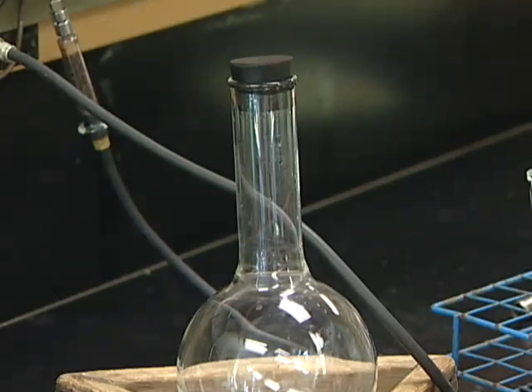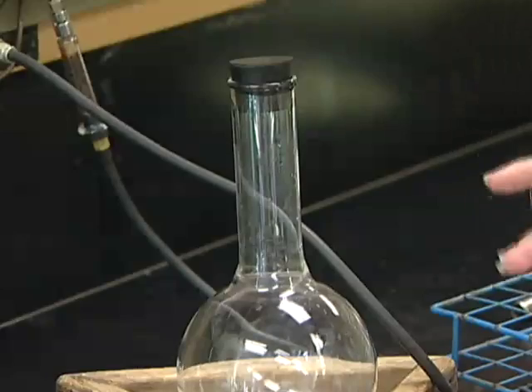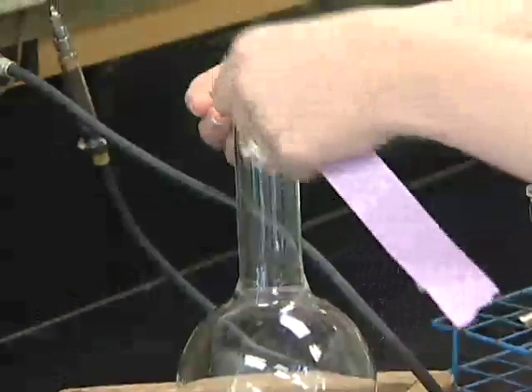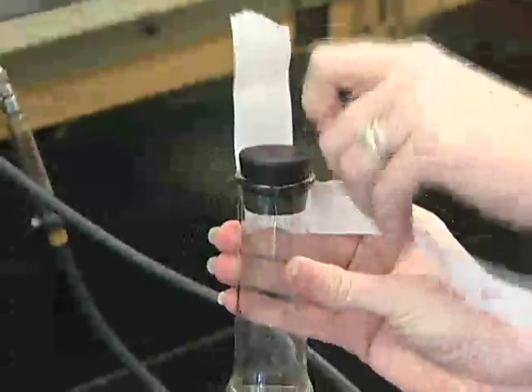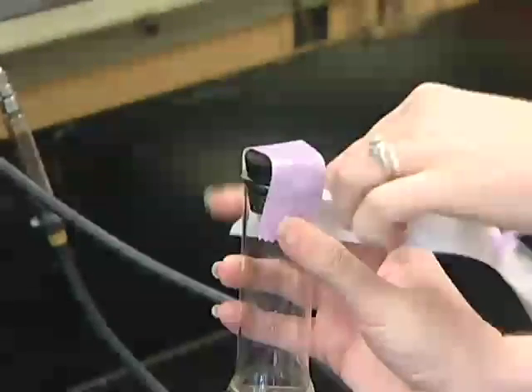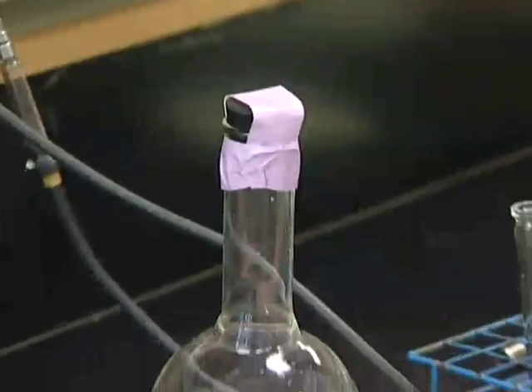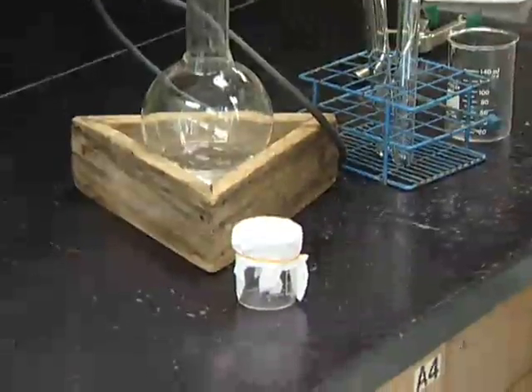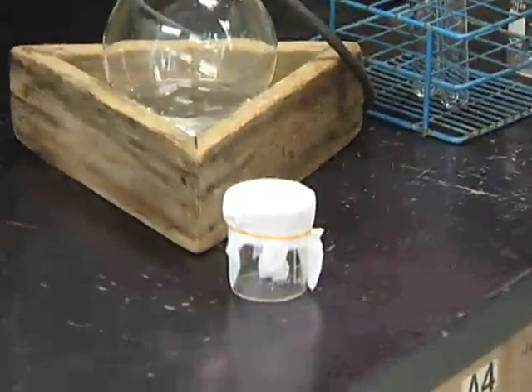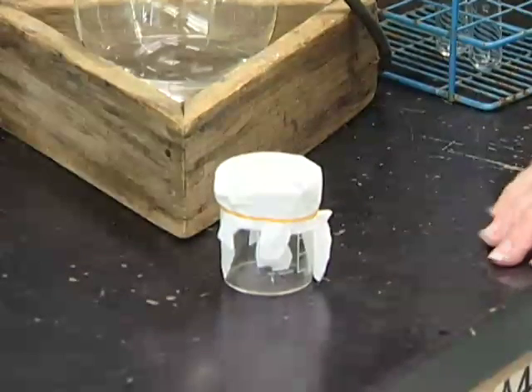Alternatively, you can do this all inside your anaerobic chamber. So after you've cooled down your water, you can tape over the top of the stopper like this, and this will keep it from coming off in the airlock. And at the same time, you'll want to cover your sodium sulfide with a chem wipe and take in everything else that you're going to need, and you can dispense it all inside the chamber, and then after you bring it back out, you can autoclave it.